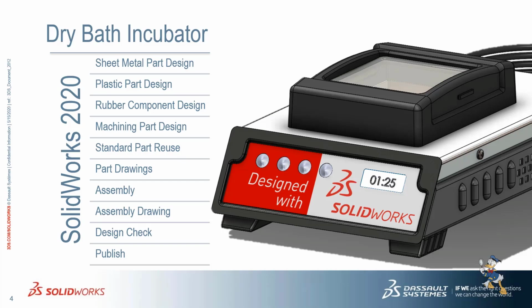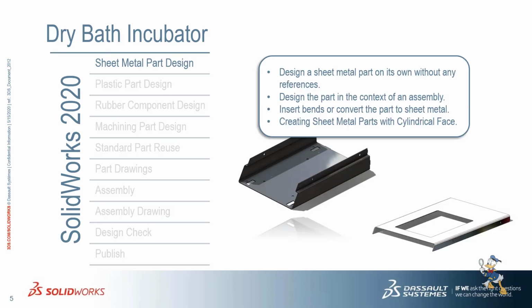So here in the Bath Incubator, many components are going to be designed, which compose this model. So let's start with sheet metal design. Sheet metal design is composed of many modules used to design a sheet metal component. We can design a sheet metal part by itself, or with reference to some other part. Designing the part in context in an assembly is also applicable in SolidWorks. Insert bends, convert the part, and creating sheet metal with a cylindrical face are also possible. So let's see in SolidWorks how it is possible.